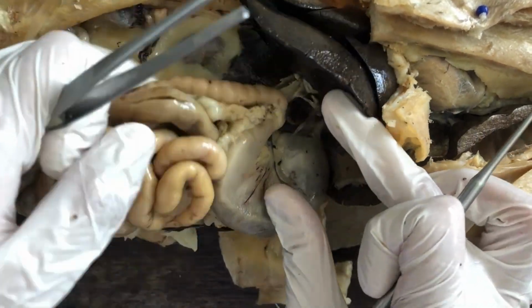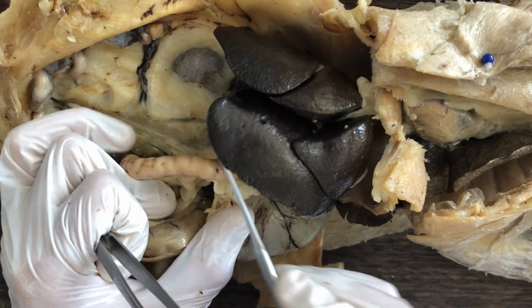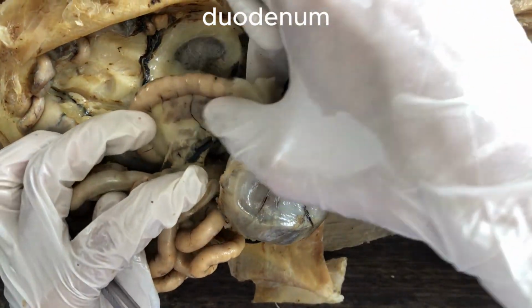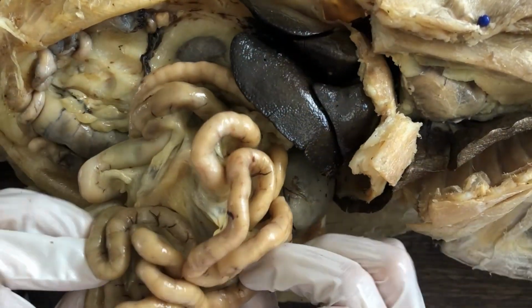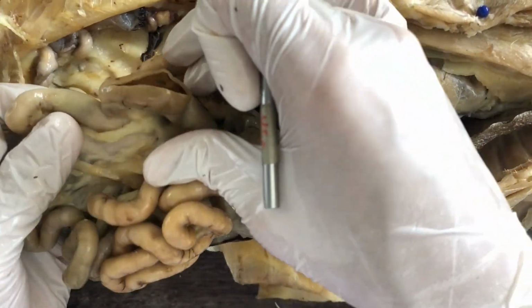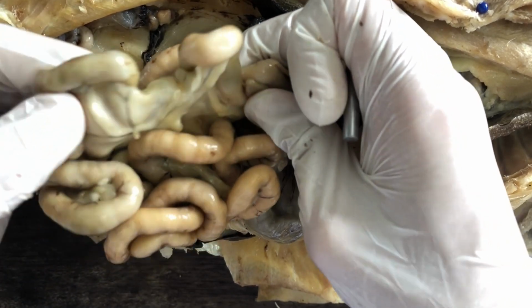And then after the stomach, the chyme will enter the small intestine. Okay, and there are 3 sections of the small intestine. The most proximal one, closest to the pyloric end of the stomach, or immediately after the pyloric portion of the stomach, is the duodenum. So that's the duodenum. And then most of the middle portion of the small intestine, the one you see here, are part of the jejunum. And the more distal portion of the small intestine next to the colon, so this is the colon already, the large intestine, and you see its boundary or junction with the small intestine. So that distal segment of the small intestine is the ileum.